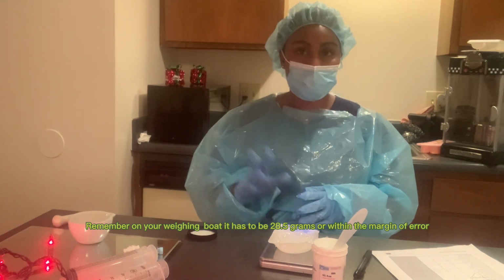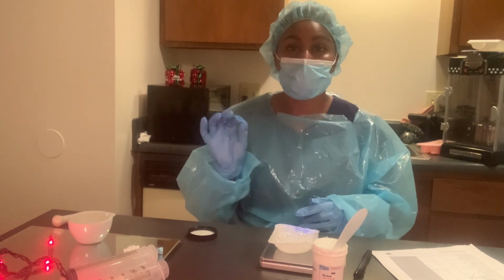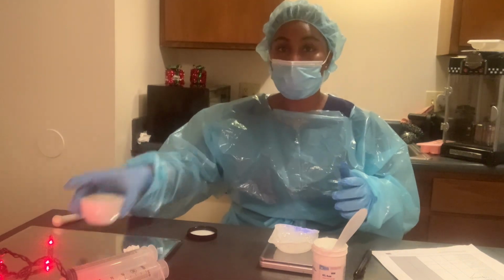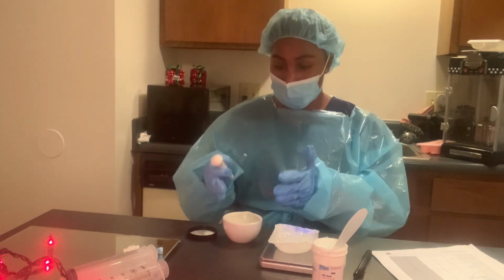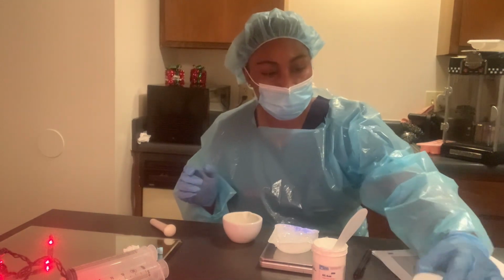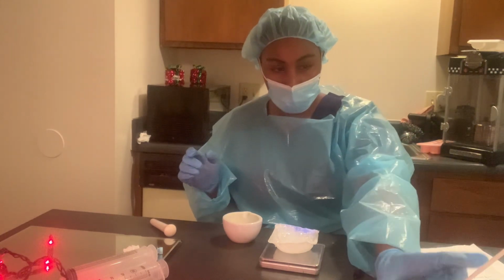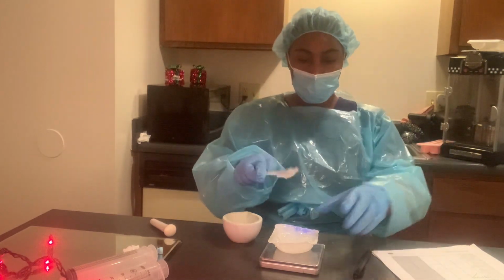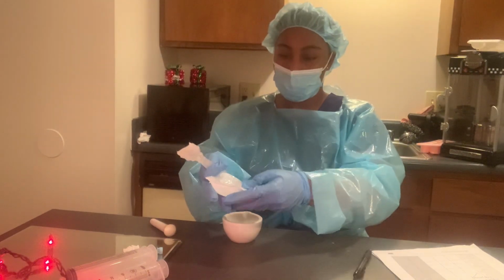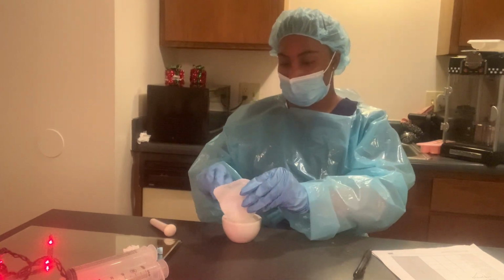So now that we have our 2 weights, which is our testosterone powder and then our gel base, we are going to add everything into our mortar and our pestle. Our mortar. This is our pestle. So I'm going to move this stuff to the side. Okay. Grab this. Take it off our weighing scale. Put that in there too. And then we're just going to mix it.